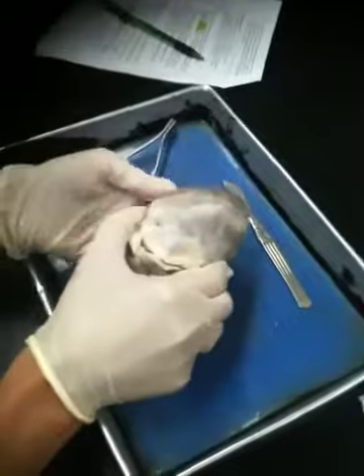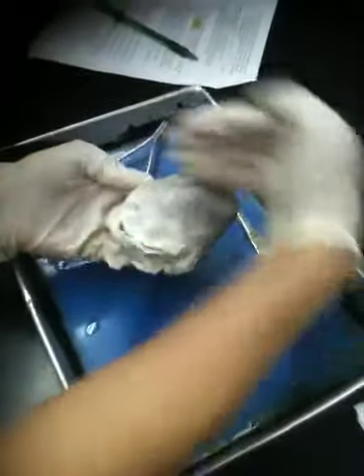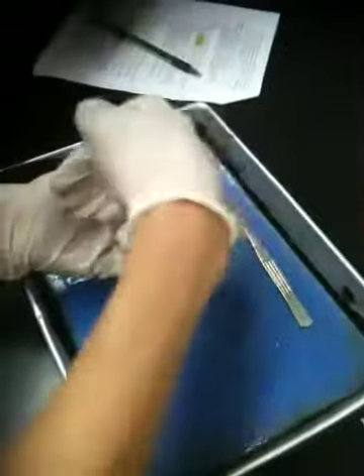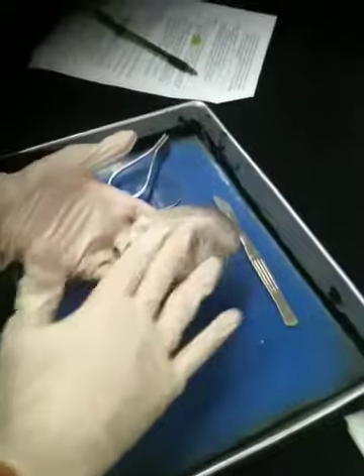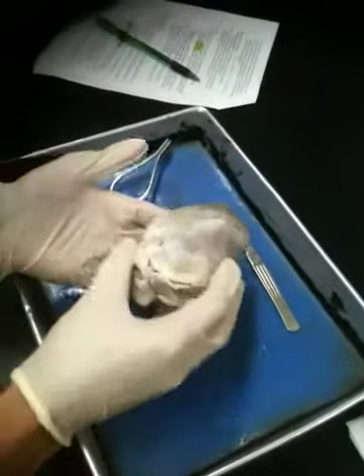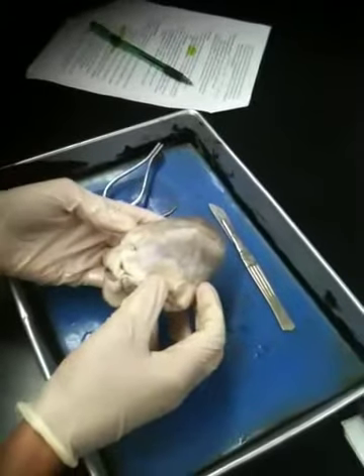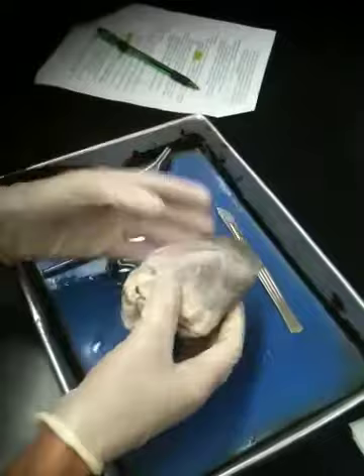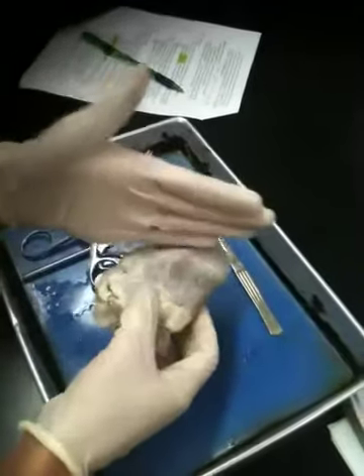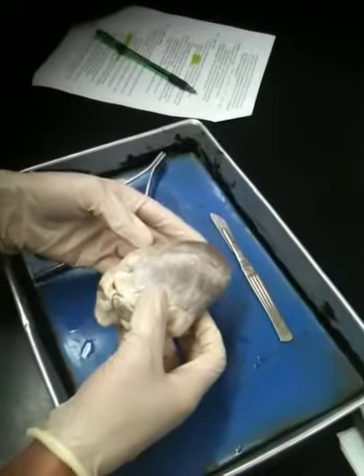Okay. So, it is the anterior or front surface of the heart that has that distinct diagonal line. For that reason, this is the right side of the heart, and over here is the left side. So that's just our first way to orient ourselves. It is a diagonal line of fat forming a sulcus right there that goes diagonally across the front of the heart, so we know that that is the anterior surface.